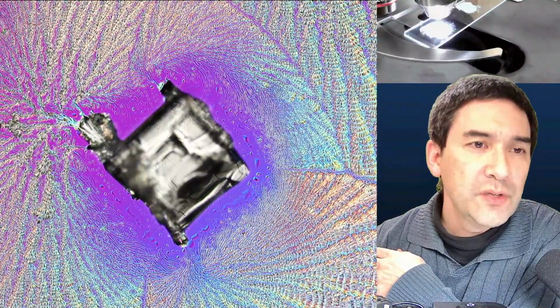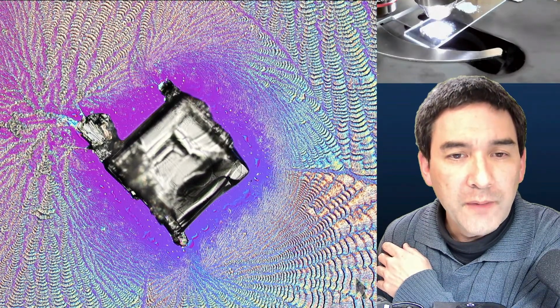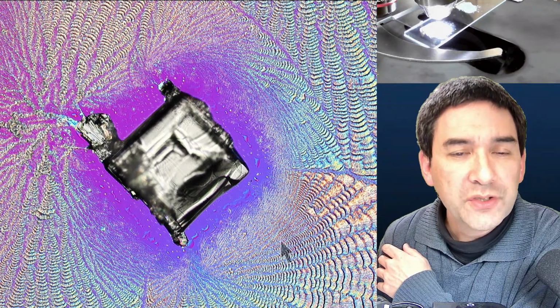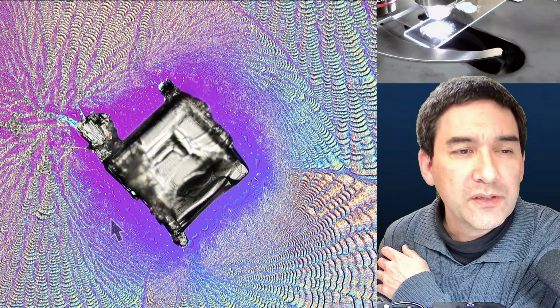So it's kind of interesting a little bit. I was wondering, you see this quite often as well. Let me turn on the... How is it possible that even though here we have this vitamin C crystal, you've got some crystallization happening over here directly on the slide, but there is this area around it without any crystals? Yeah?